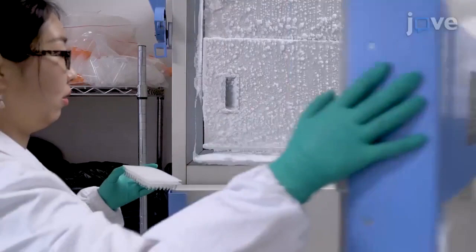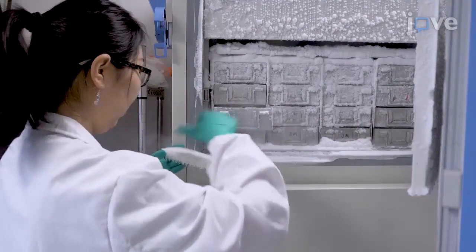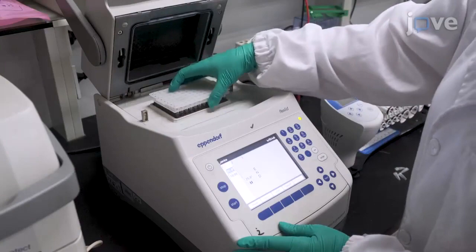Freeze the plate in a minus 80 degrees Celsius freezer for 10 minutes. Then defrost the plate at room temperature. Incubate at 95 degrees Celsius for 10 minutes.